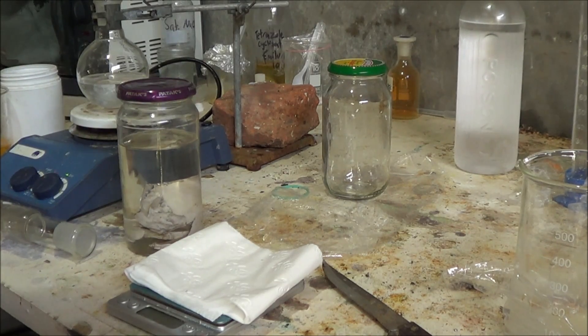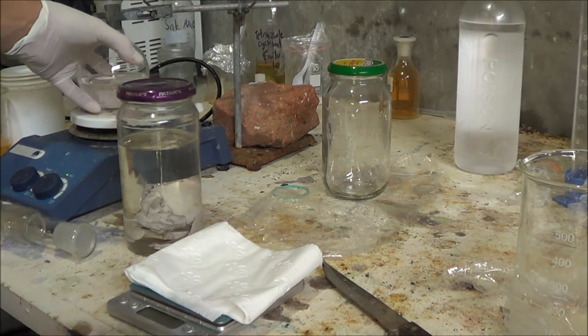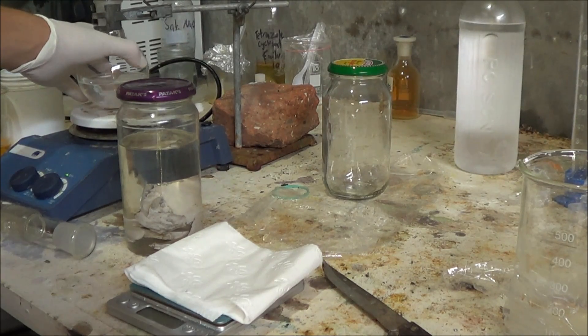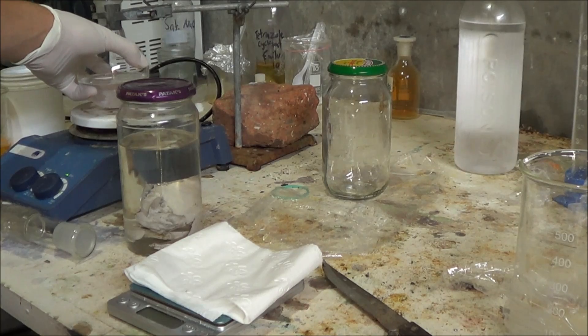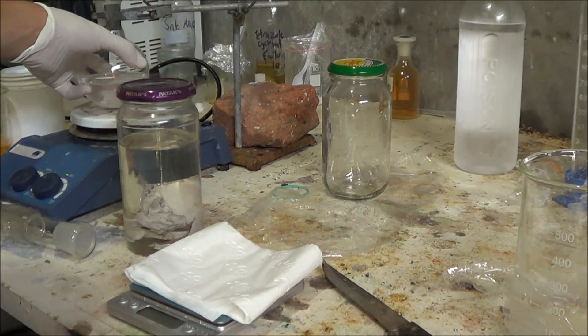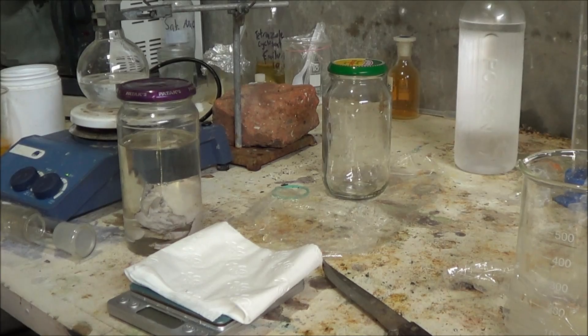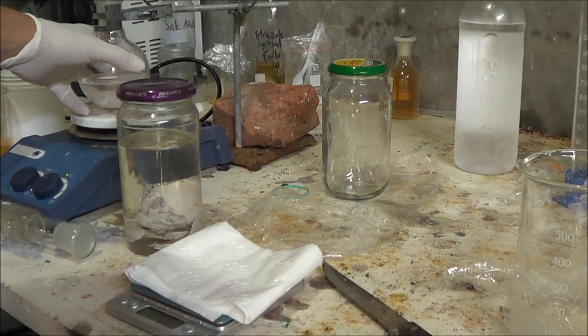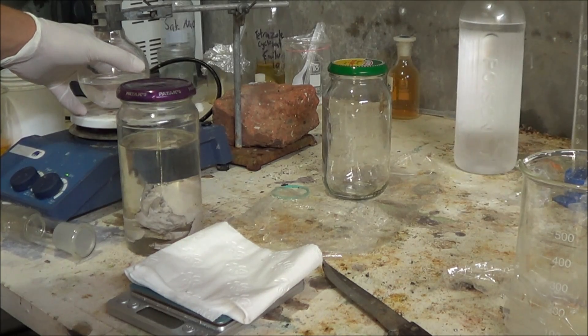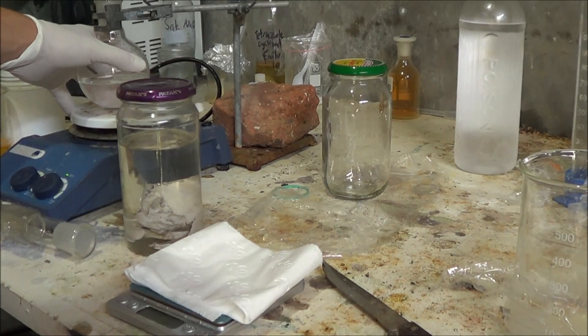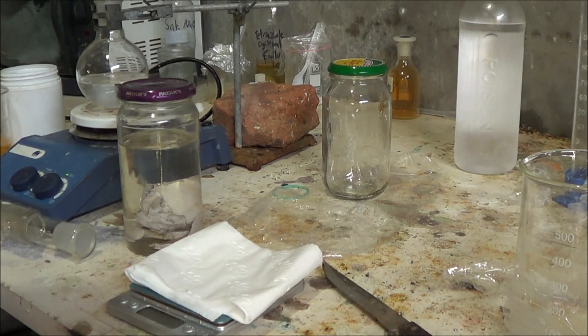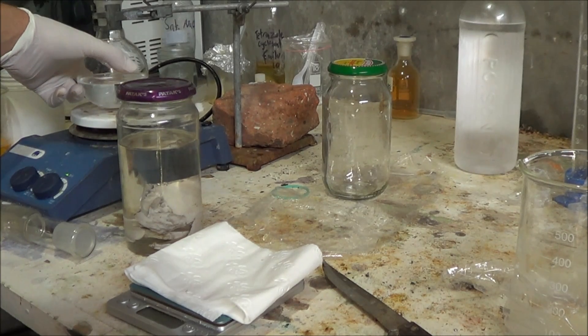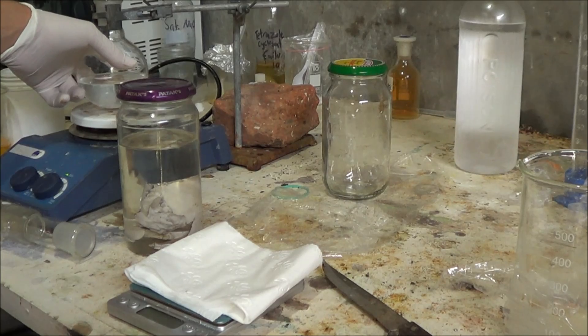So I don't have a stir bar in there because I think sodium and the other metals, alkali metals, are one of the few things that can really screw the Teflon in the stir bar. But if the reaction really needs a stir bar I'll chuck one in later. Lower it in slowly so I don't smash the flask. But it might destroy the stir bar, but it's not so much an issue seeing as they don't actually cost that much money.